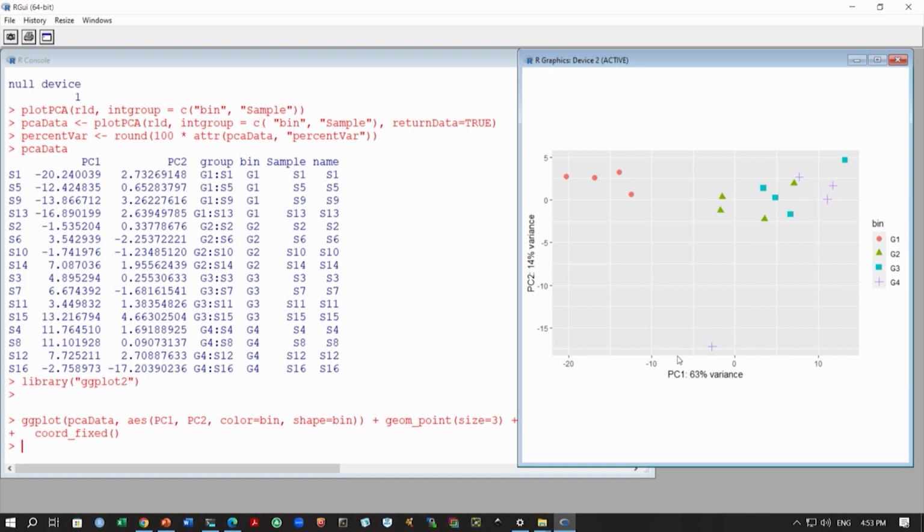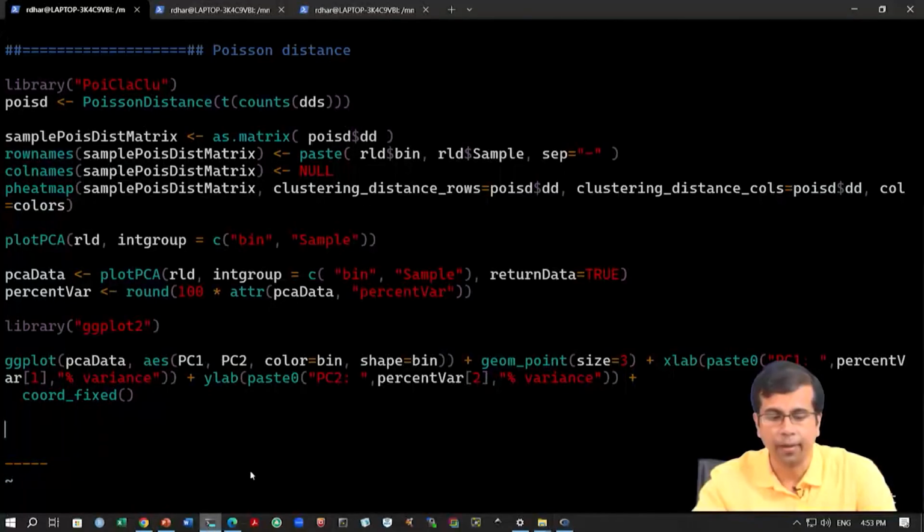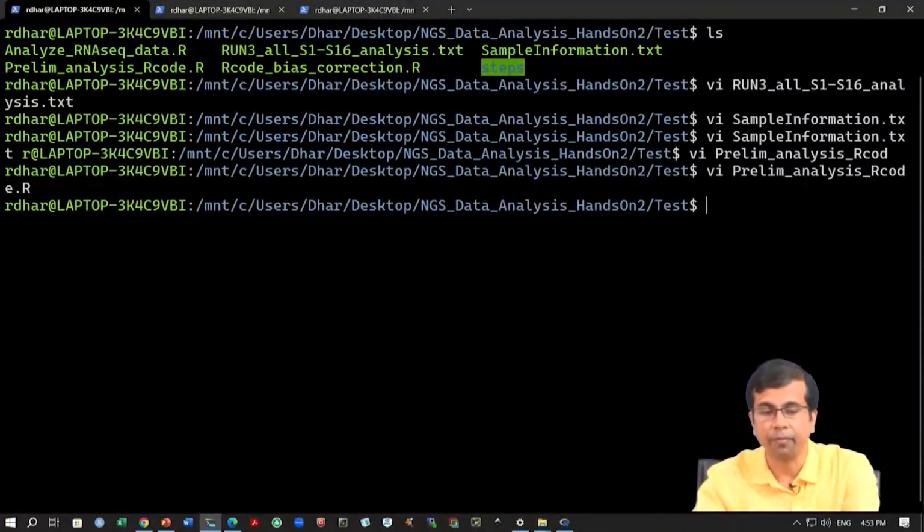So, we have now finished this preliminary data analysis, and we can now move on to the bias correction part. We have discussed different types of biases that we can see in RNA-seq data, and we can try to at least identify or minimize some of these biases. So that's what we are going to do now in the next step. And for this bias correction part, we'll use this package called EDASeq.